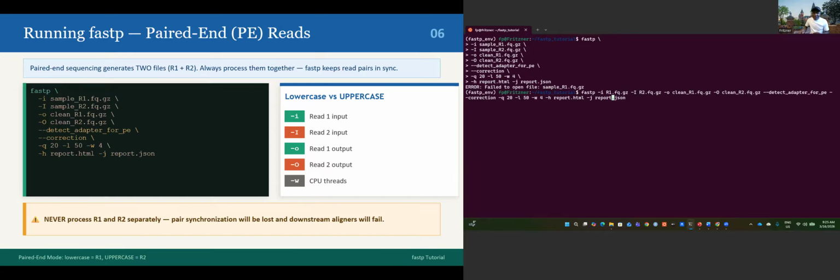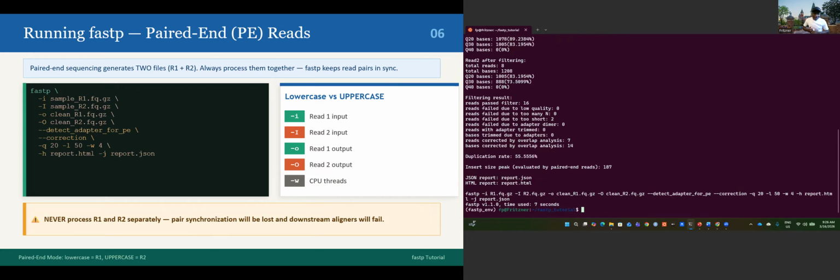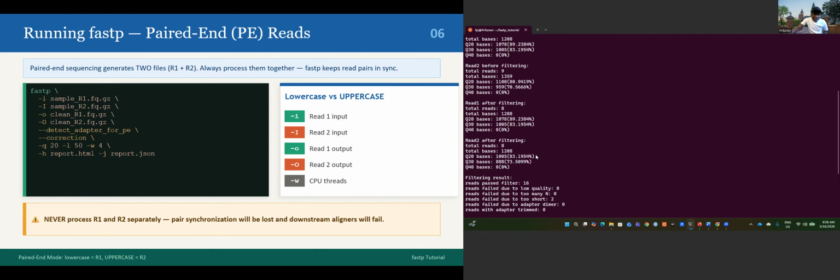This is a way to troubleshoot, because scripting is not easy. You still need to mess up sometimes, but what is important is to know where to go to correct your mess. Yeah, it's working. Okay, it's done in 7 seconds. That's a good speed, I guess.